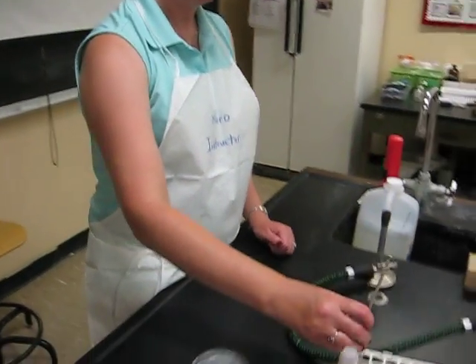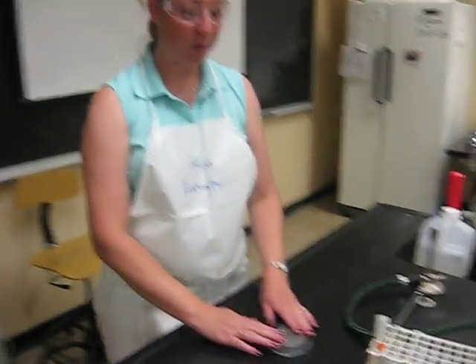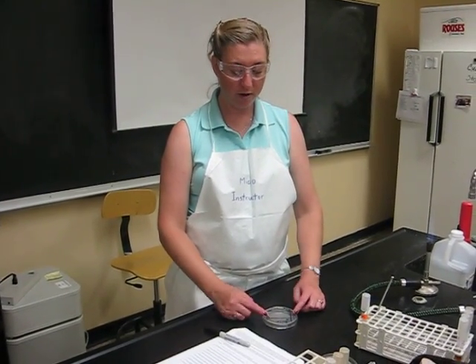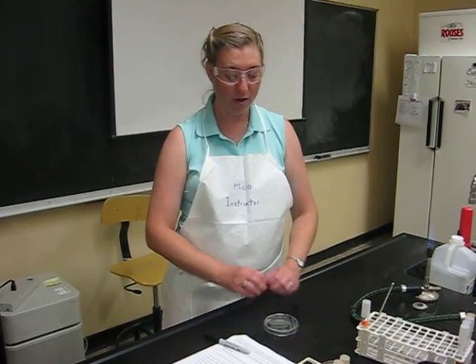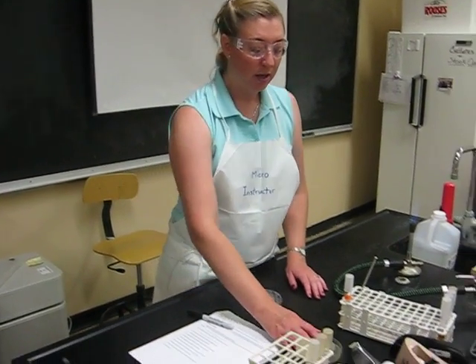Done. We'll put this in the incubator flipped over so any condensation on the lid doesn't land on the plate and spread the bacteria through the movement of water. Later on, hopefully we'll have colonies, little circles.